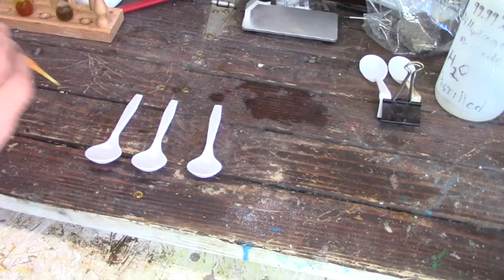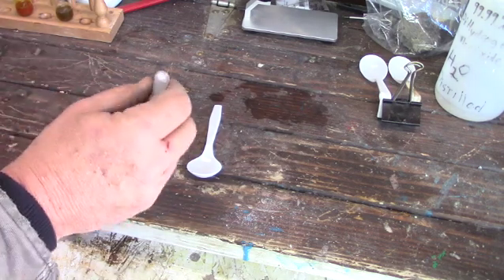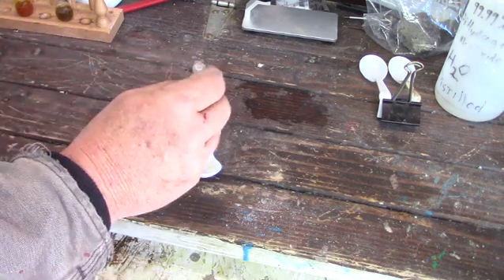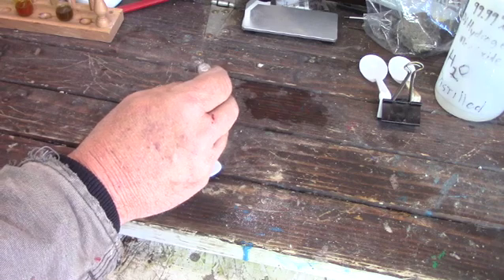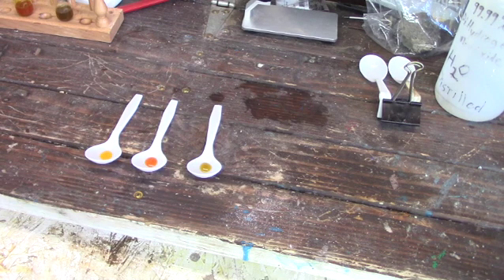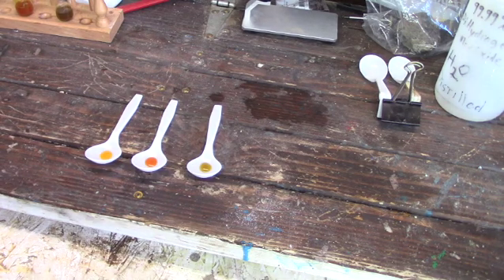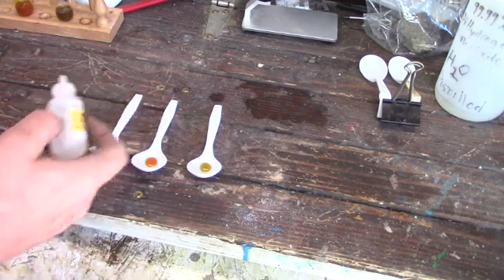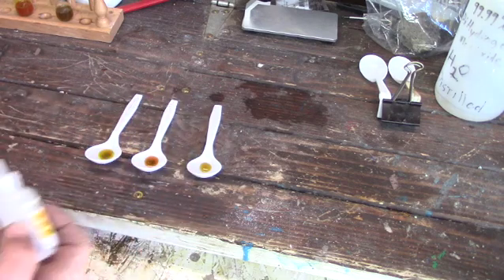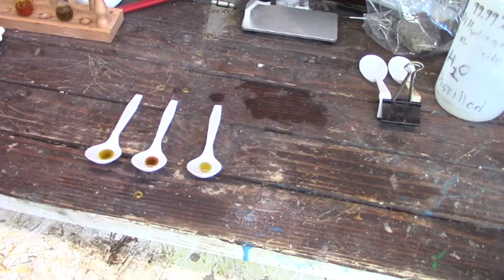Now just as a matter of course, we're going to do the spoon test — just a few drops of each solution in each spoon, and then we'll apply our stannous chloride and see what we get. Using the spoons means that you don't have to have so much solution; you can use less acid and a smaller sample to generate your fluids and still be able to test them. Once again right to left: A, B, and C. Putting our stannous chloride in — that looks good, a nice dark color happening there. That one too. And the third one — nothing really.